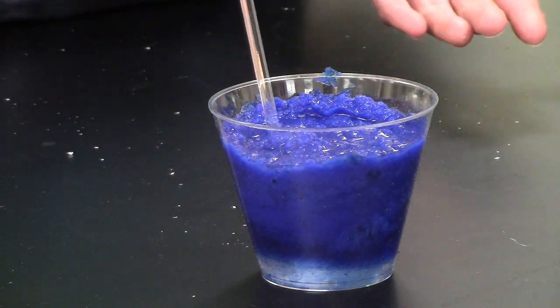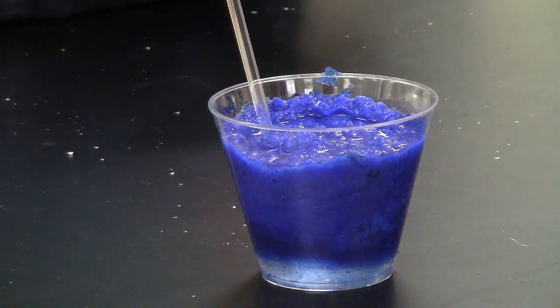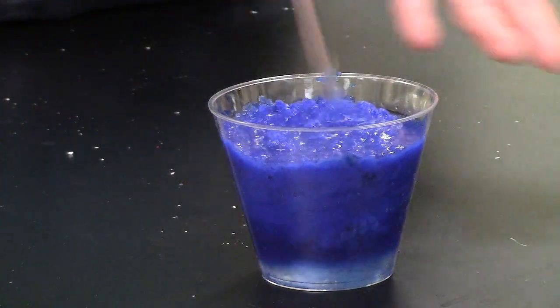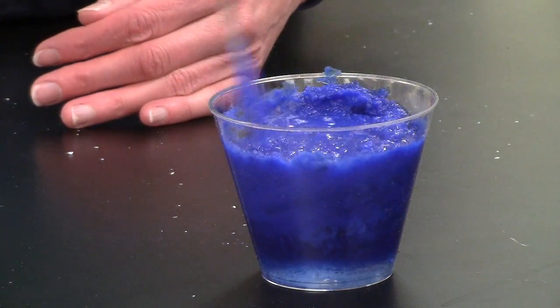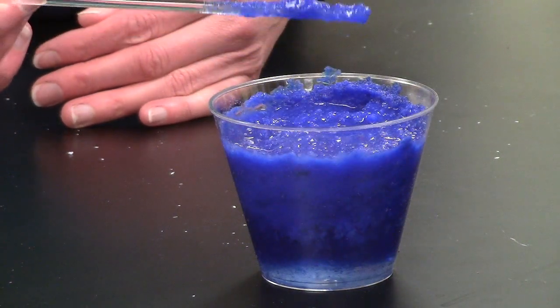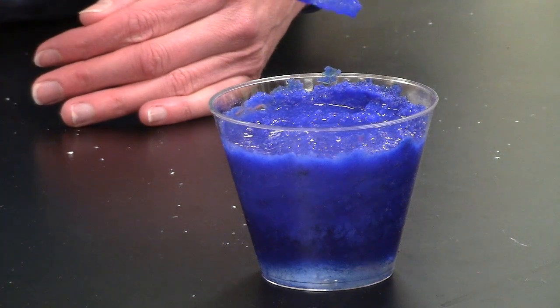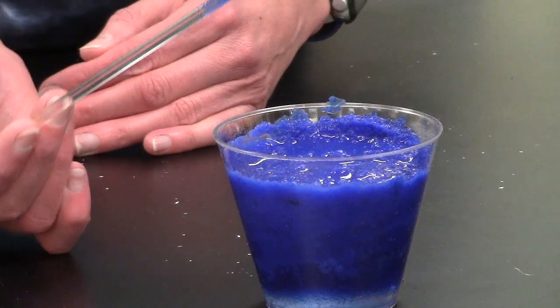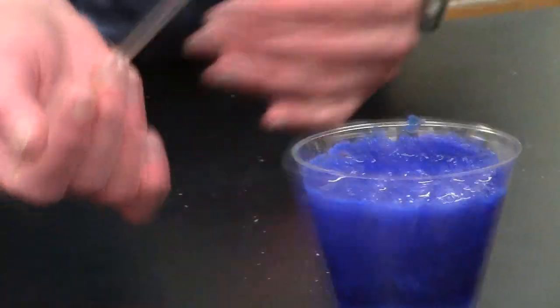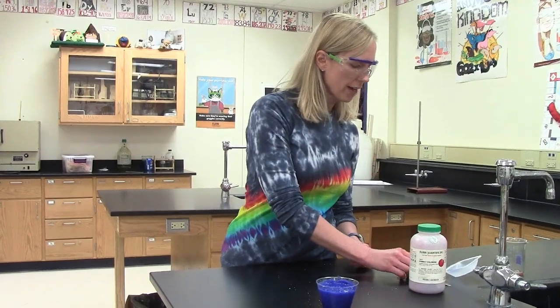Now, sodium chloride does dissolve in water. And so that is still floating around in the water that we've got here. But what's most noticeable, of course, is the chunky precipitate that we created, which is insoluble in water. And that is typically what we look for in a double replacement reaction: when two aqueous solutions are combined, a precipitate is typically created as one of the products of the chemical reaction.